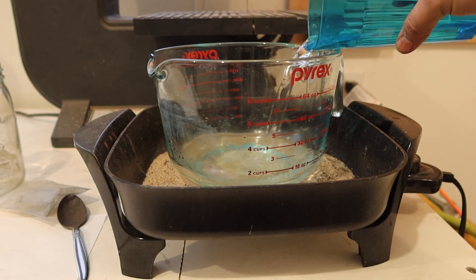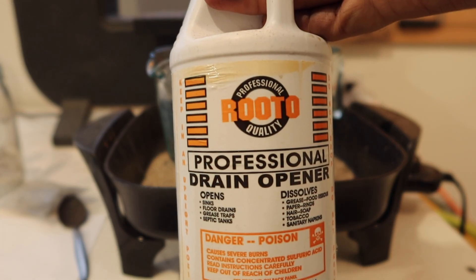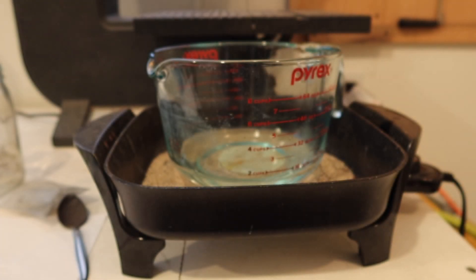When I'm done pouring all the bars, I make a dilute solution of sulfuric acid on the hot plate to remove any flux.